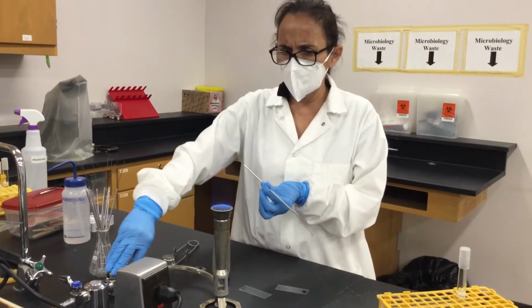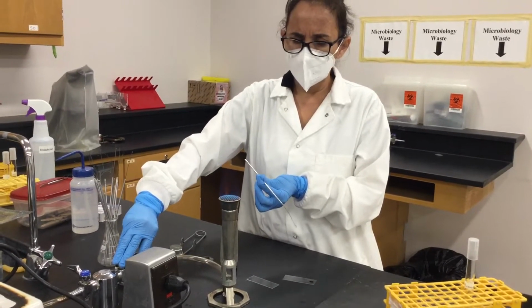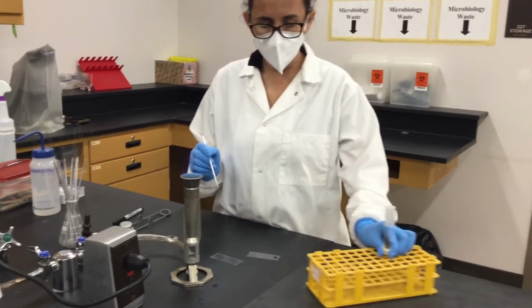Let me drop the intensity, it's so hot. And then let it cool here for a minute or so. And then you will grab your bacteria.